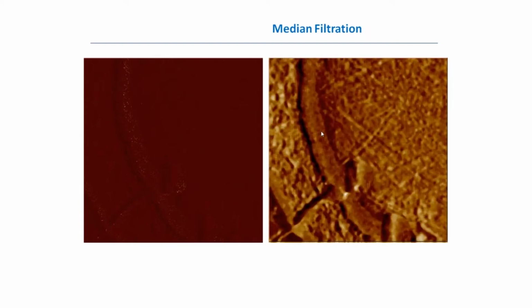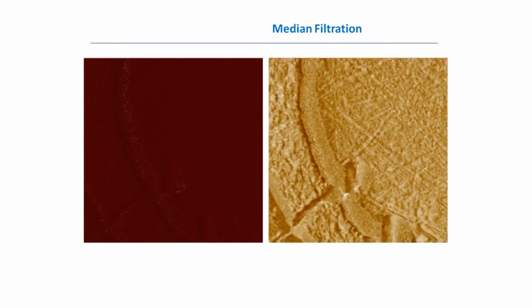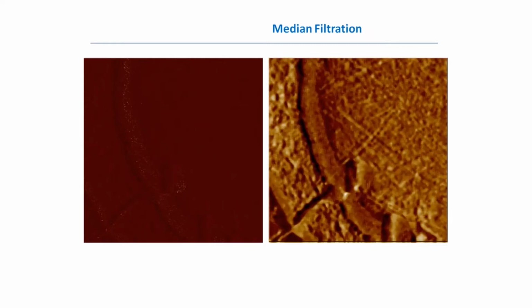But at the same time, if we take too big a kernel, too big a matrix for this median filter, meaning that we use not 3 by 3 like in the previous case, but for example 5 by 5, our details start to disappear. So together with noise, we start to distort the signal. So once again, when you use some tools, don't use them too much.